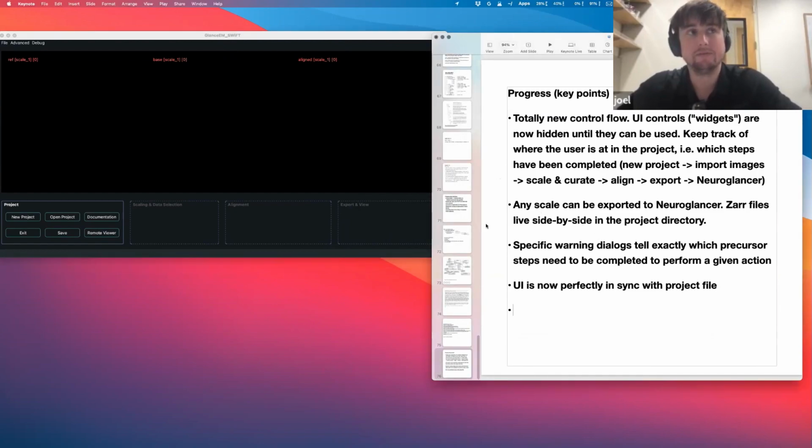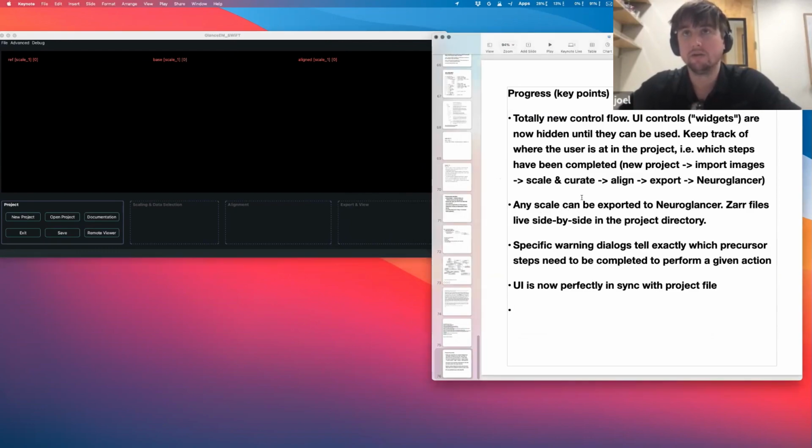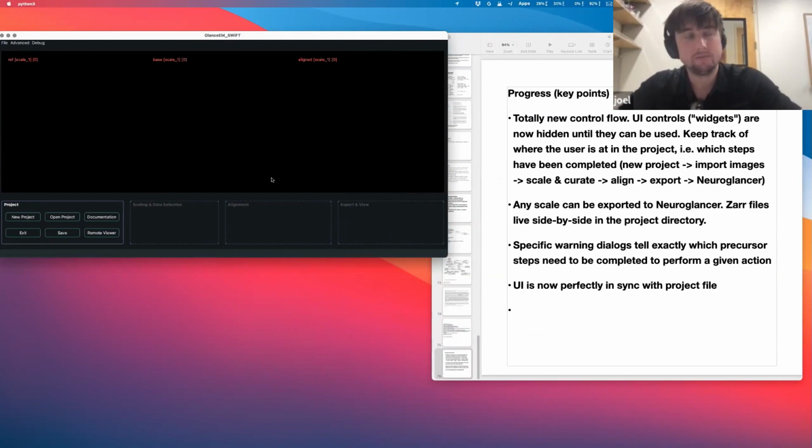The features which are going to make this app super intuitive are the new UI flow, and the way the UI flow works is elements like widgets become activated and accessible only when they can actually be used. Instead of having a ton of controls, there are key steps as you progress through an alignment project. First, you've got to import your data. You've got to select which images you want. You might have some bad images, and you've got to scale.